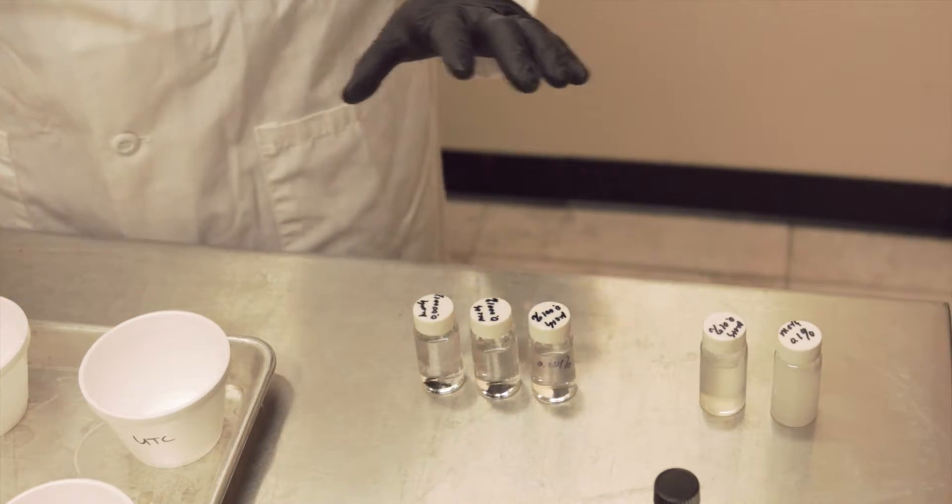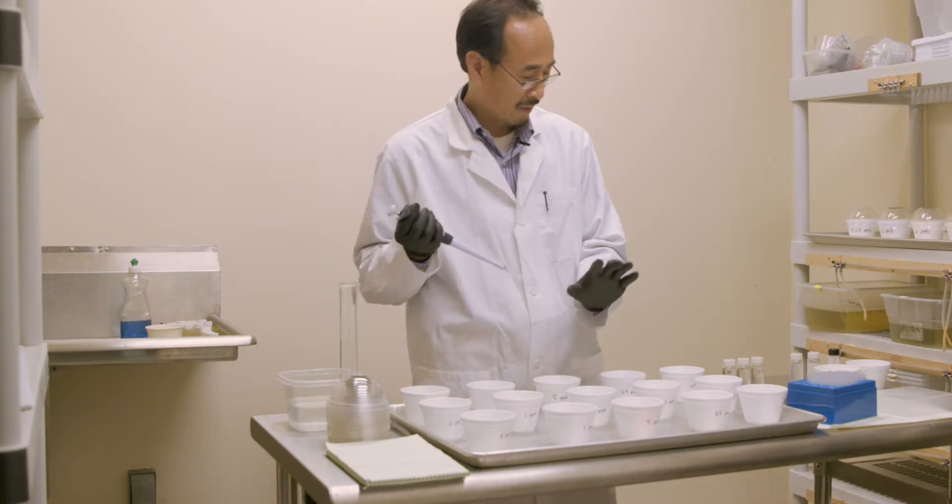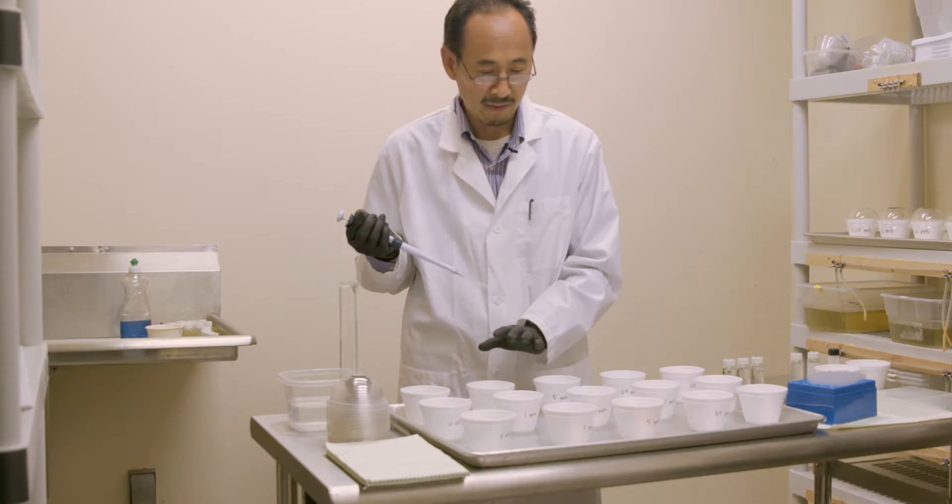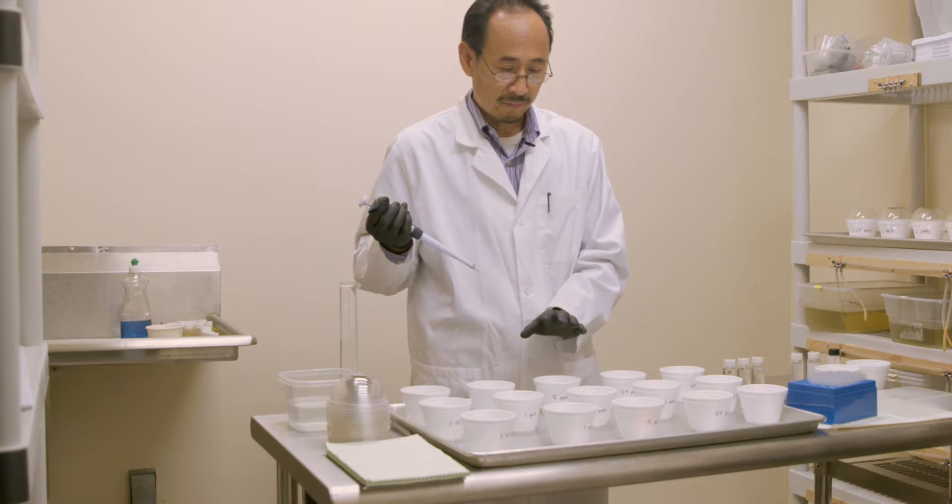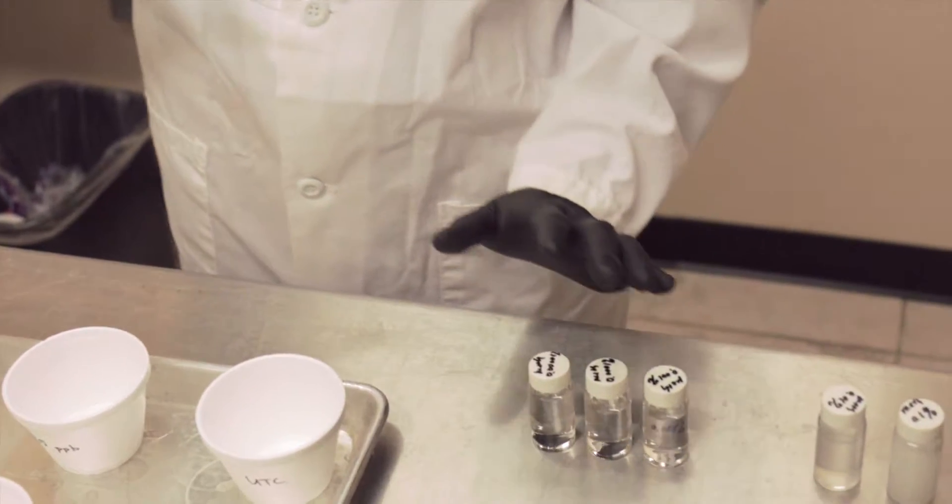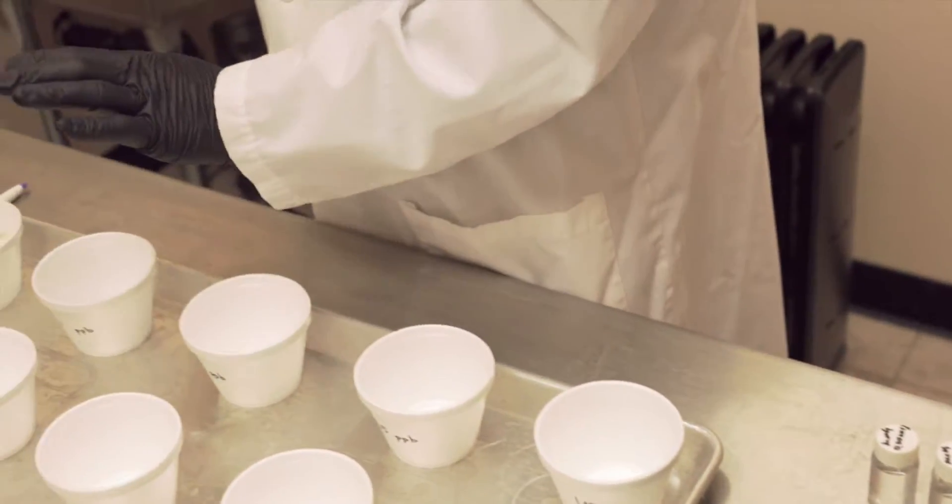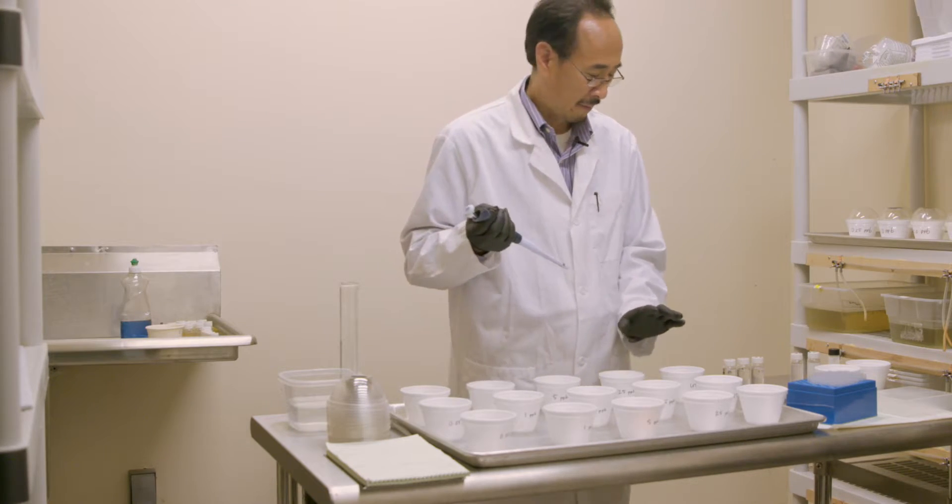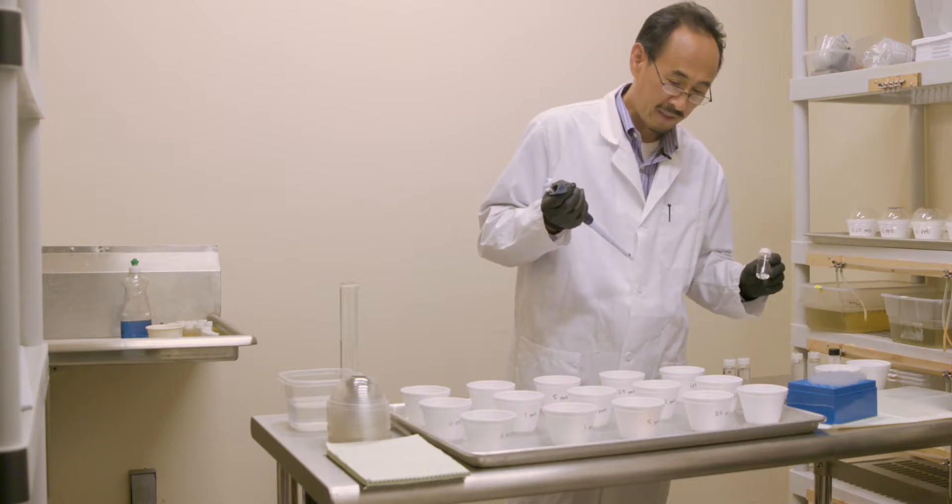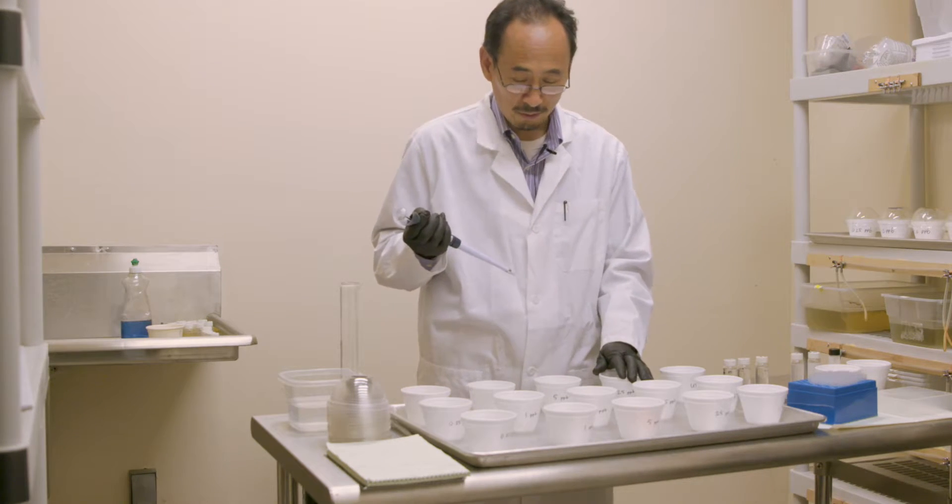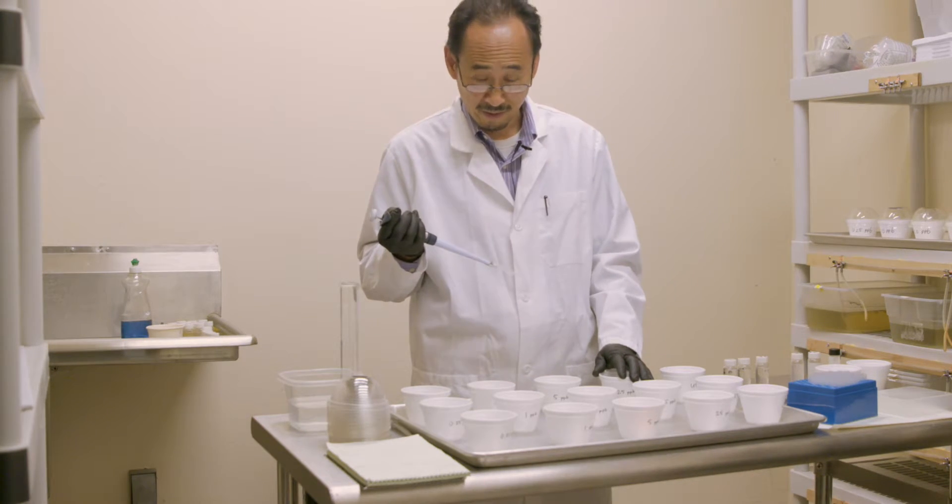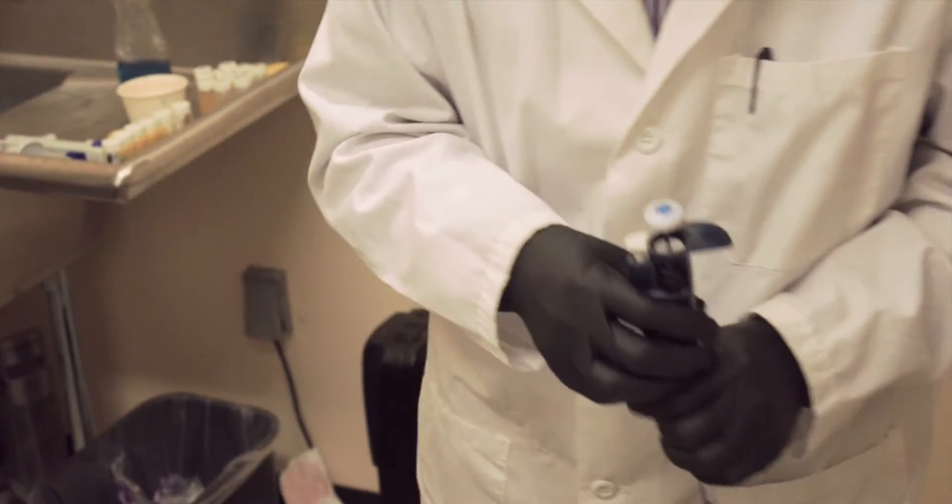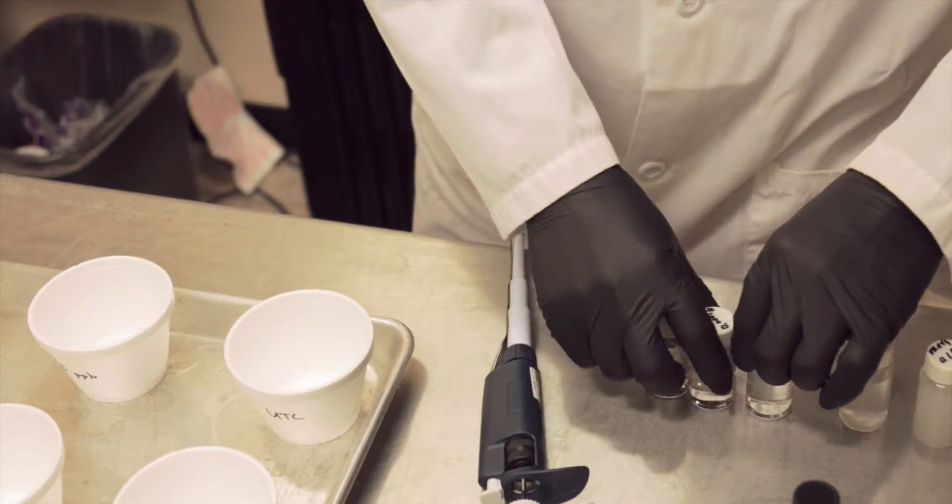You can verify your final parts per billion versus the parts per billion in this vial in the amount of 100 milliliter. We ignore the difference of your added amount from here to this. For example, the last one, you add 250 microliters, your actual volume after treatment is 100.25, but we consider it as 100. That is the fractional difference. So that would be the treatment.